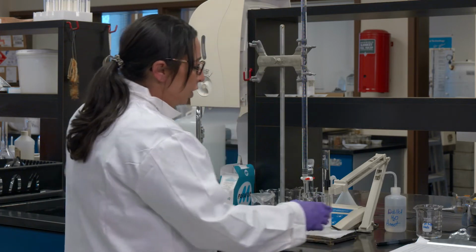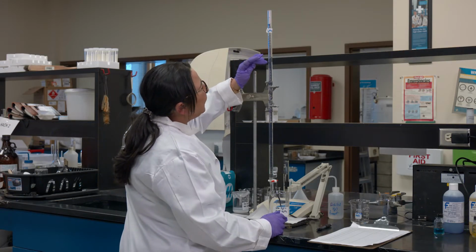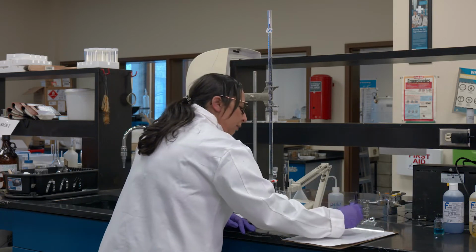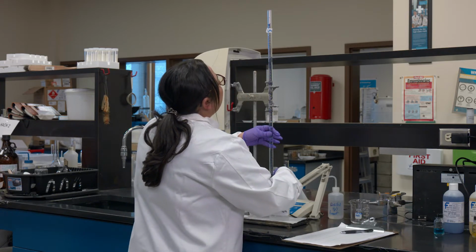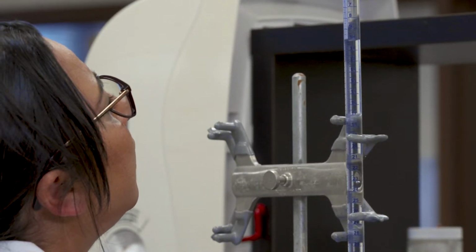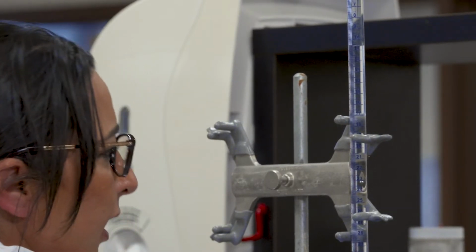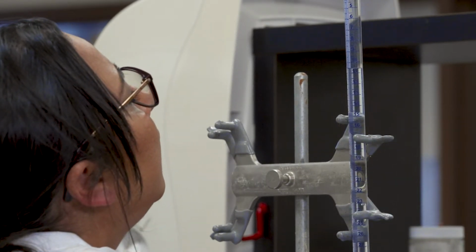As I said, I'm going to start with 1 ml. My starting point is not 0, I'm starting at 10. So that's how I'm going to start recording. You can do the same and see how far the pH changes after adding 1 ml. I will be focusing more on the burette this time and slowly add 1 ml. Just to remind you, for liquids we go with the lower meniscus, so I will keep an eye on the lower meniscus. In case you feel you're off, you can move your burette to bring it to your eye level.